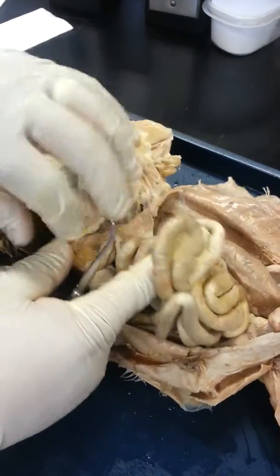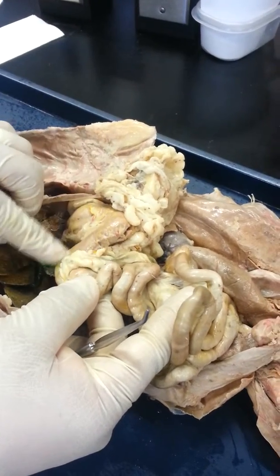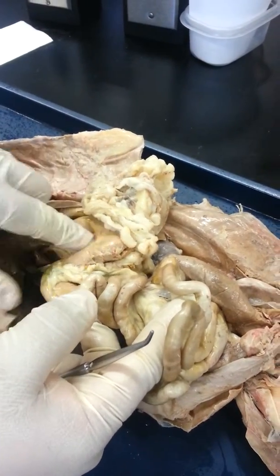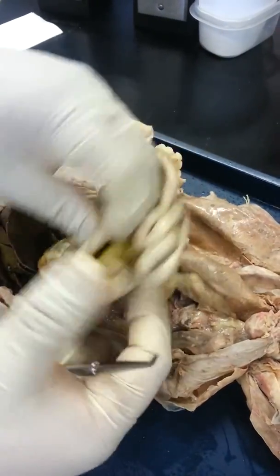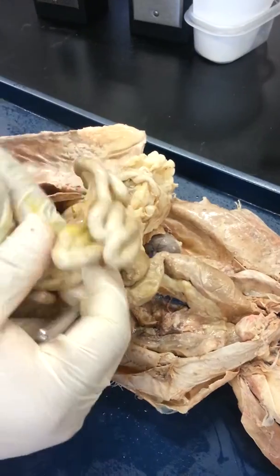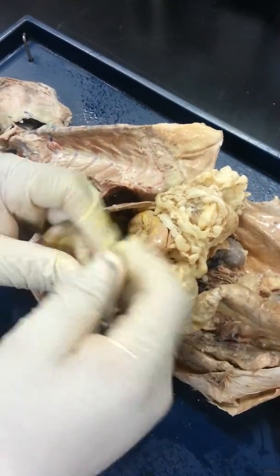So if we go to the small intestine, again you see the pyloric region of the stomach. This brief segment of the small intestine after that pyloric region is the duodenum. Right? So if you see a pin here and you see the stomach in close proximity, then it has to be the duodenum. The rest then becomes the jejunum and the ileum. The jejunum would be the middle portion. So most of what we're seeing right now is the jejunum. As we start to get towards the end of the small intestine, that's where we get into the ileum.